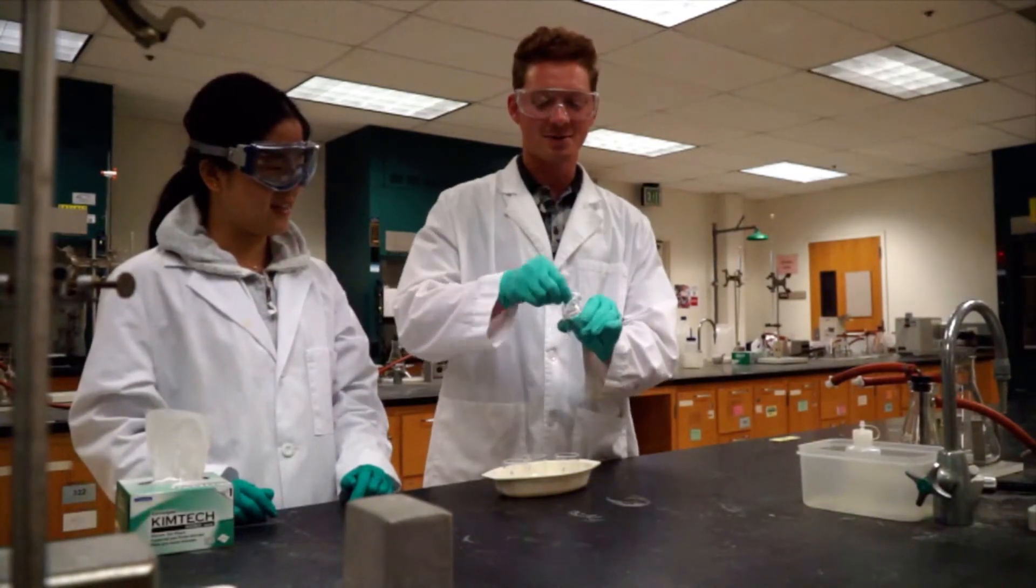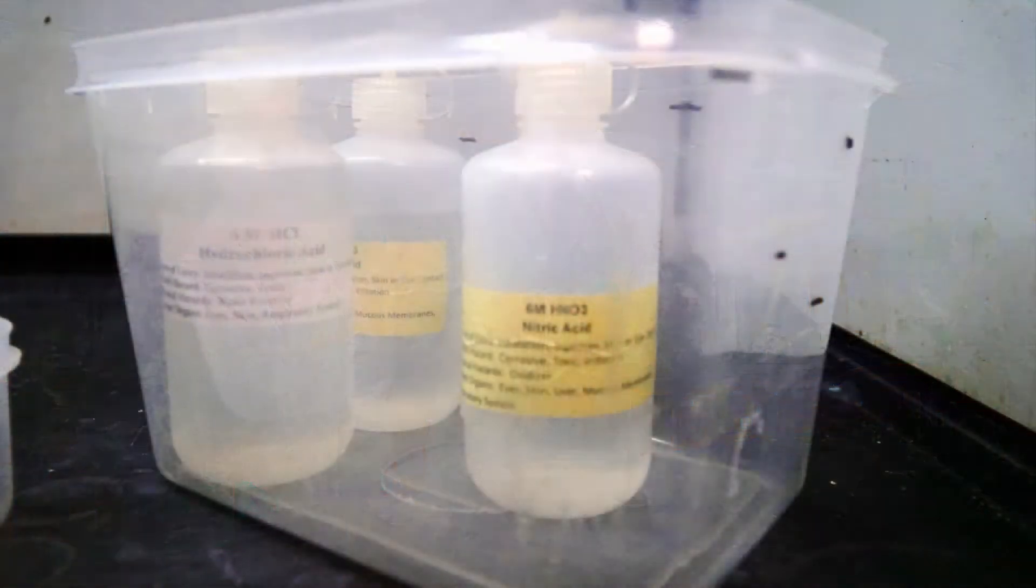The frit is cleaned chemically with strong acid, followed by a basic wash to dissolve salts that have clogged it.